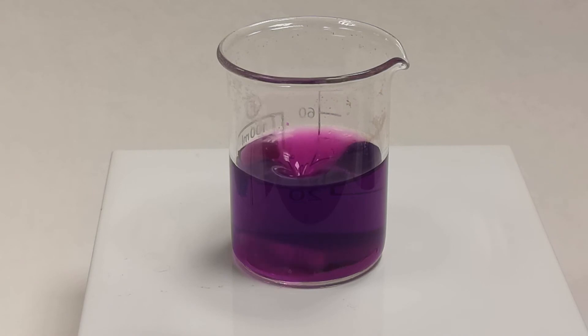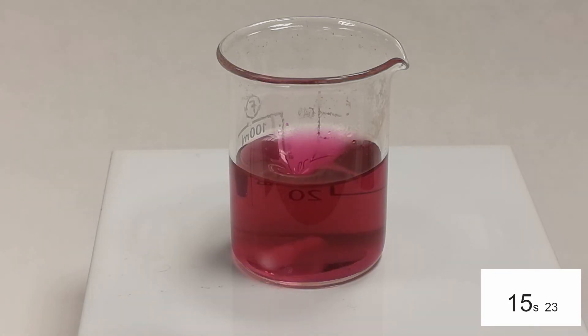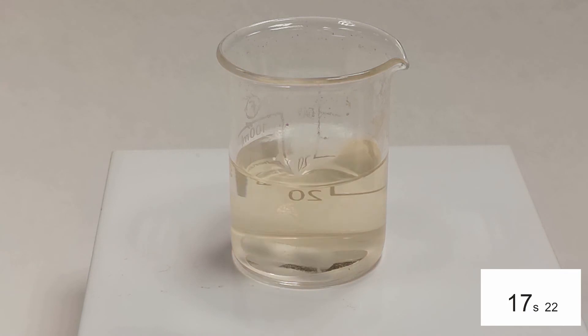This time the solution is at 60 degrees celsius and as you can see the reaction takes place much faster. In fact it is colourless in under 20 seconds.